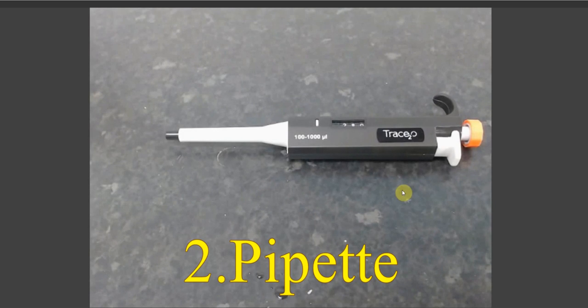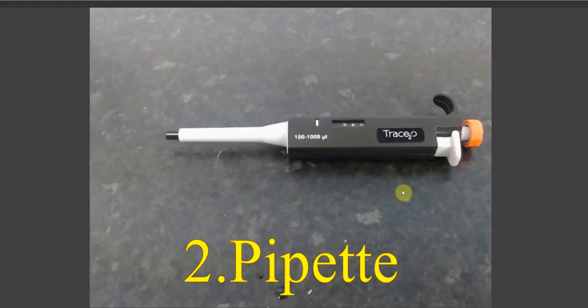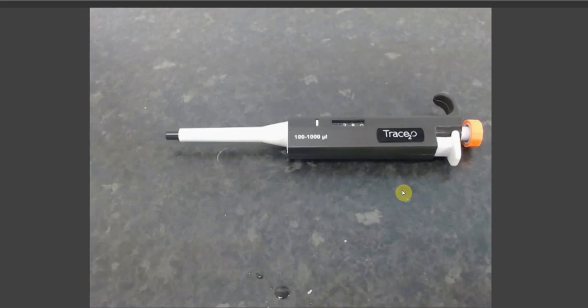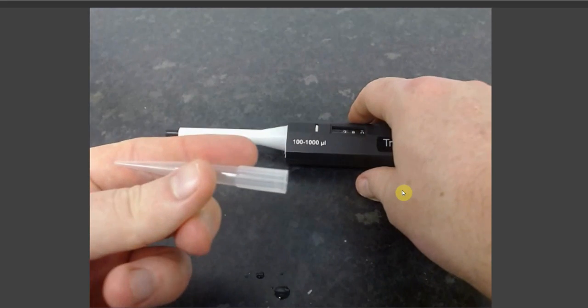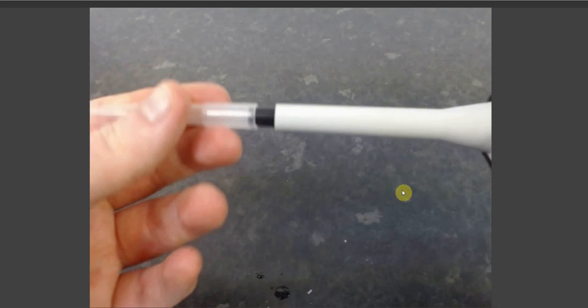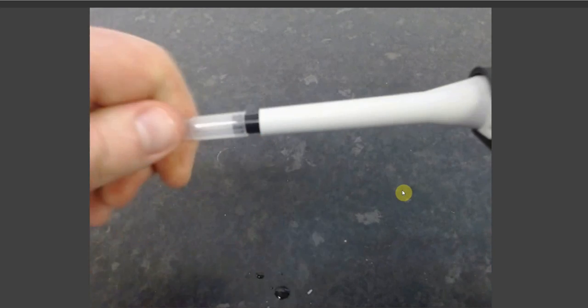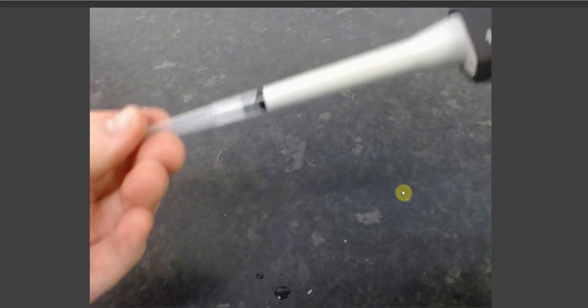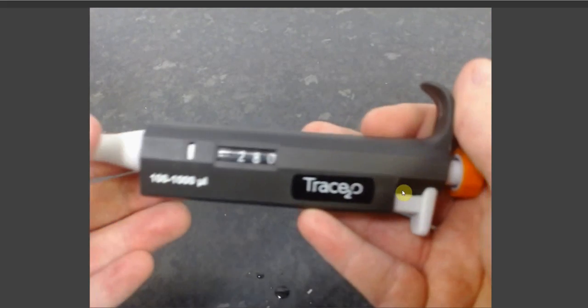In this video we will be covering the use of the TRACE2O pipette. Your pipette will arrive as shown. To begin the use of your pipette, it is first necessary to take a TRACE2O pipette tip and simply press it very firmly onto the end of your pipette. Once you have done this, your pipette is ready for use.